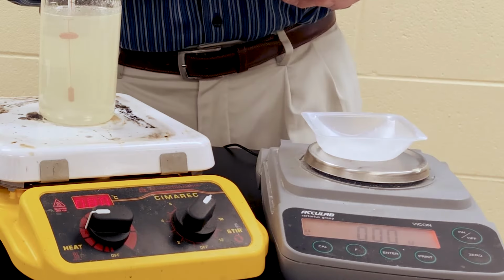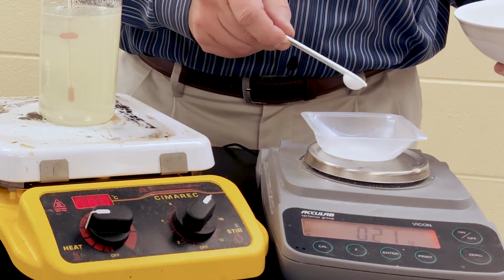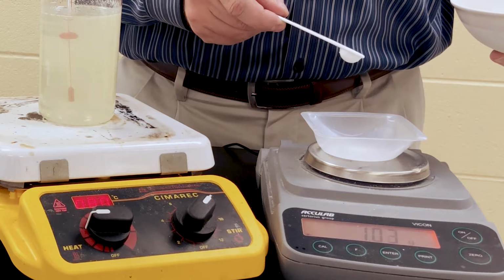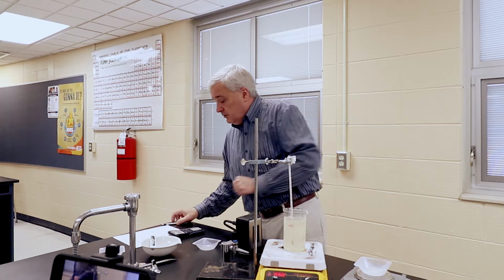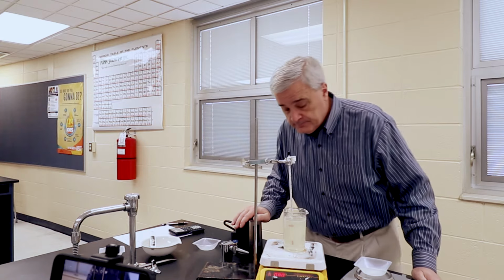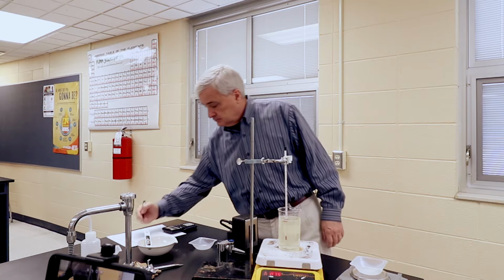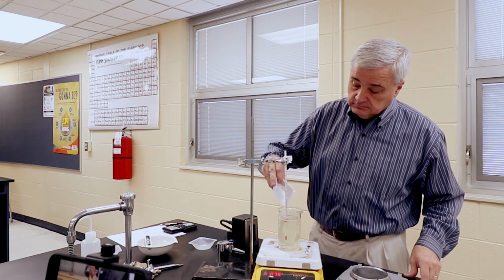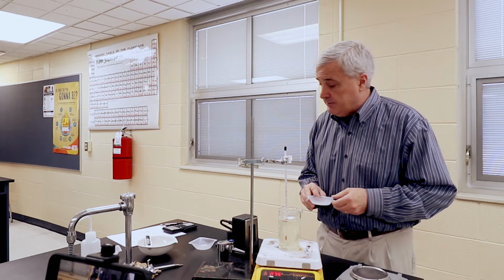Sometimes my students get super intense on getting exactly 1 gram. I'm not trying to be that. 1.05. 1.05 more. Dare we try? Dare we try? 81 degrees. 81 degrees. Put that in there. See what happens.